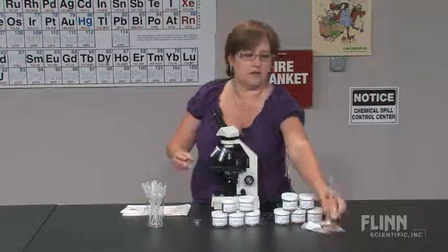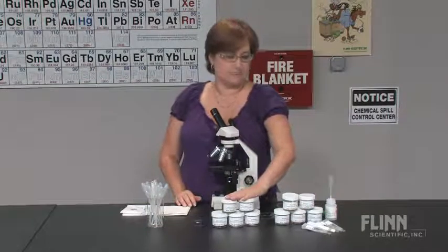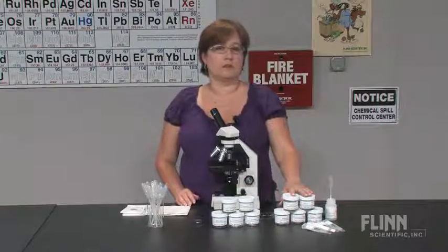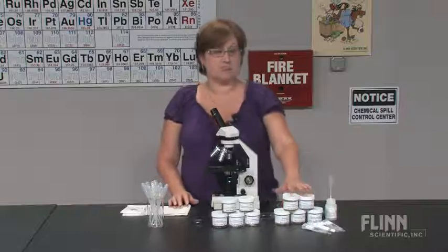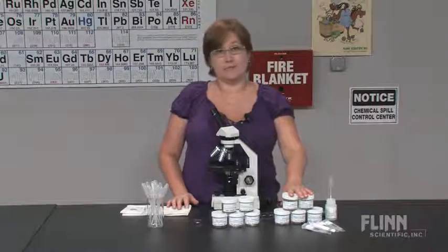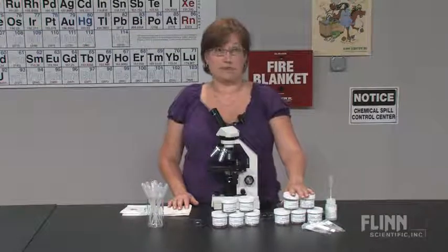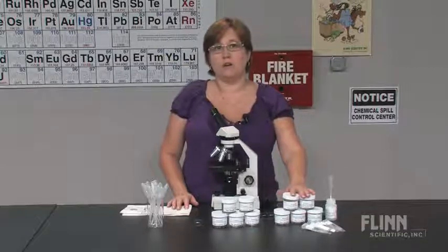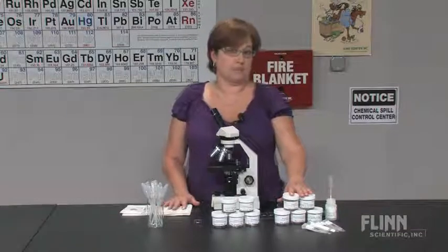If you receive culture jars because you need a larger sample, you need to know where to look within the culture jars to find the microorganisms. Some microorganisms love light — dim light or maybe even bright light. Others are more light-averse and will move away from it, actually forming a small ball or in other ways protecting themselves from the light source.